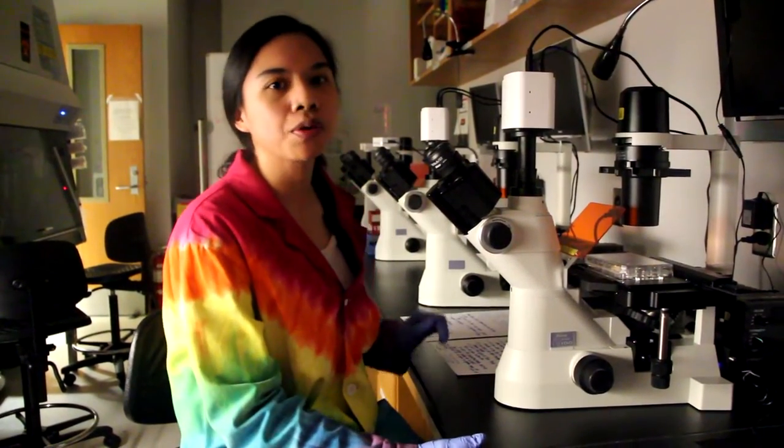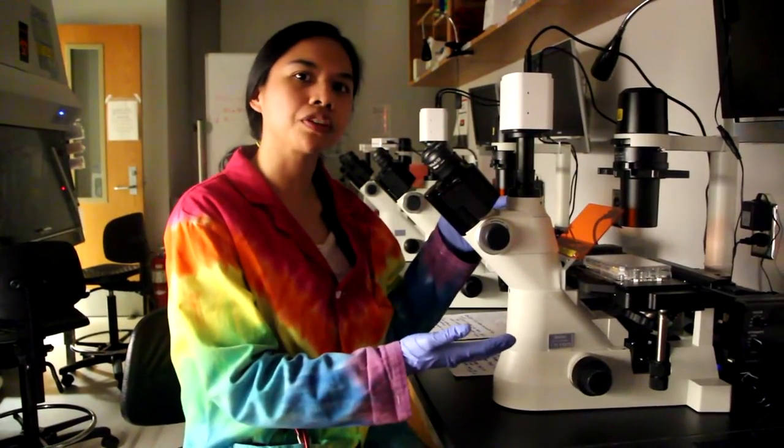Hi, I'm Dr. Garcia at the biotechnology program at NC State University, and today I'm going to be talking to you about how to use our inverted microscopes.